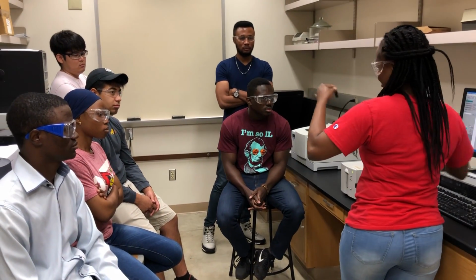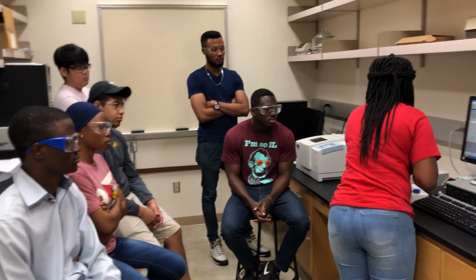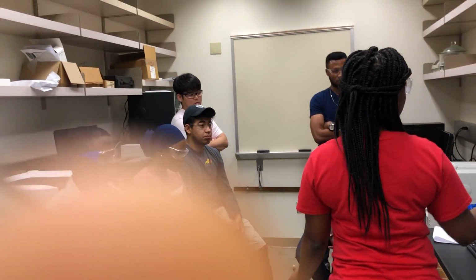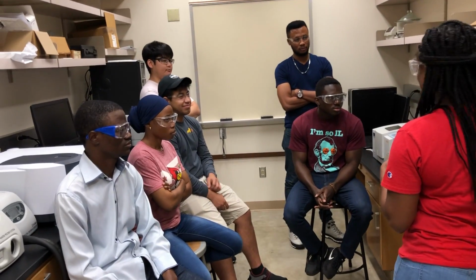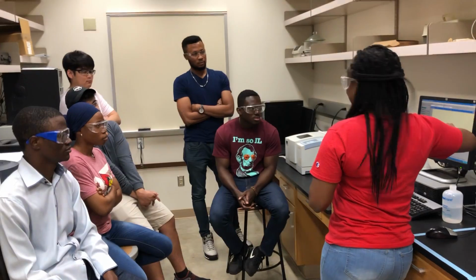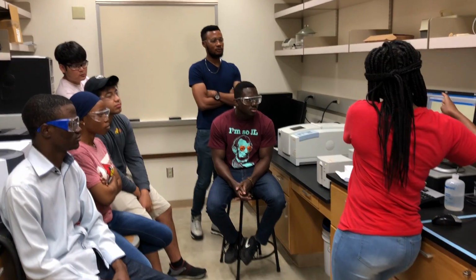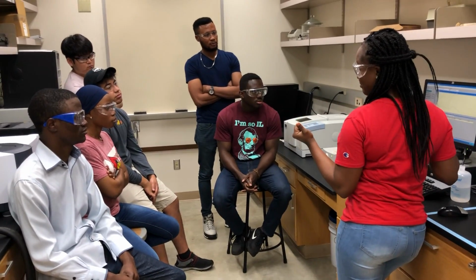Don't forget to wipe. You don't need your fingerprints. You need a clear light to pass through our sample. So now you press sample, and then this runs. So let's see the magic the UV gives us. Boom, you see that there's a hump here. This shows the gold nanoparticles with the SPR. So this shows that it has a broad SPR, and it tells us that the particle size is big.